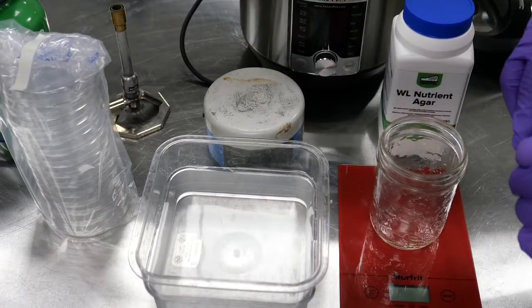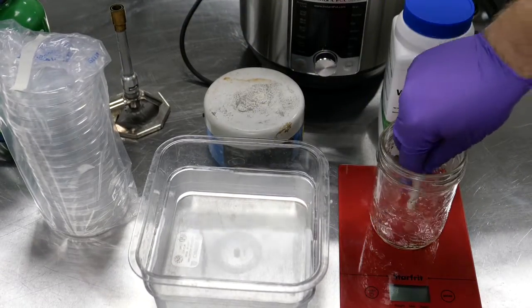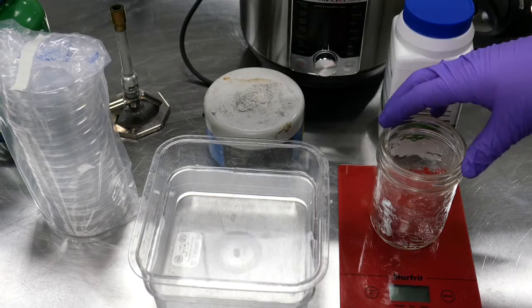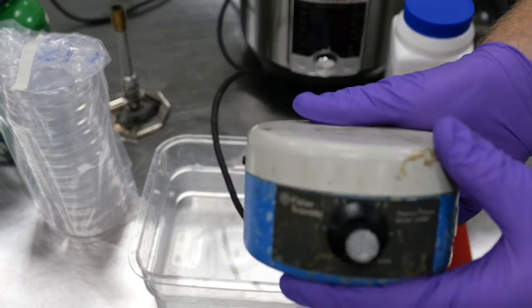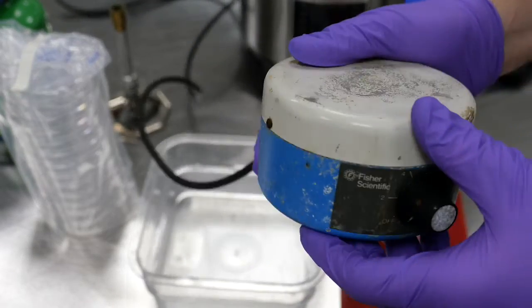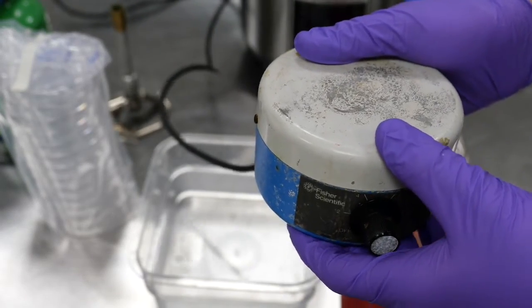You'll need a stir bar that's going to go into your container. You're going to need a stir plate. I've got an old scientific stir plate here, but any homebrew stir plate will do just fine.